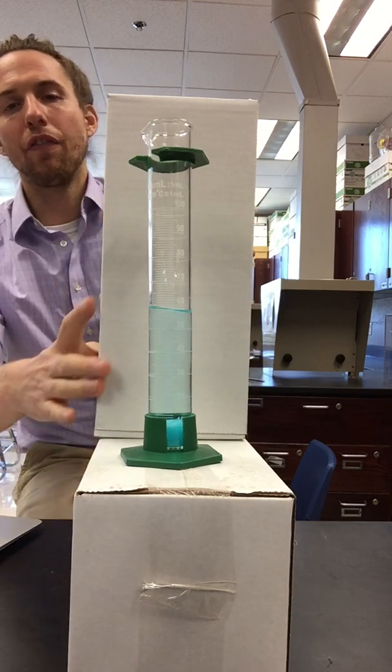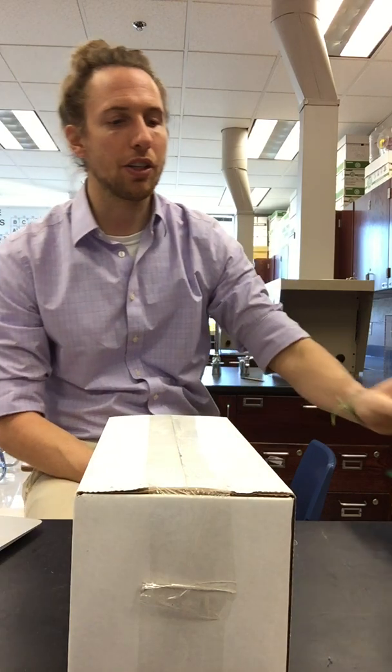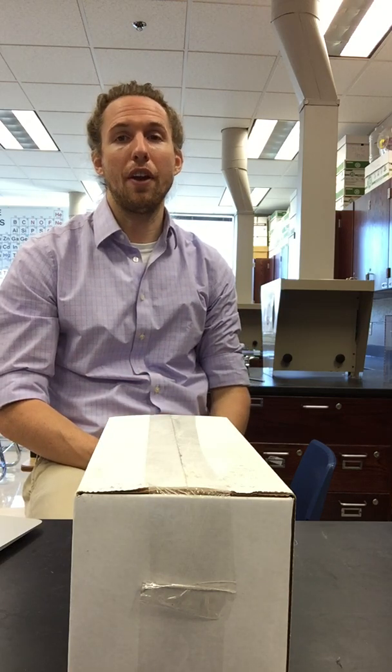So now that you have all of the volume of precipitates for all of our different reactions, we can go through and we can crunch some numbers. We can start to figure out what the most effective ratio was stoichiometrically, but that is all of your data for determining the stoichiometry of chemical reactions.